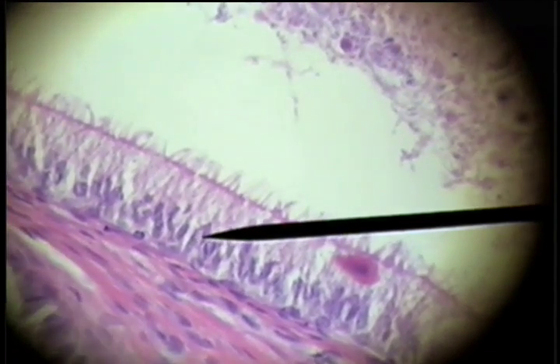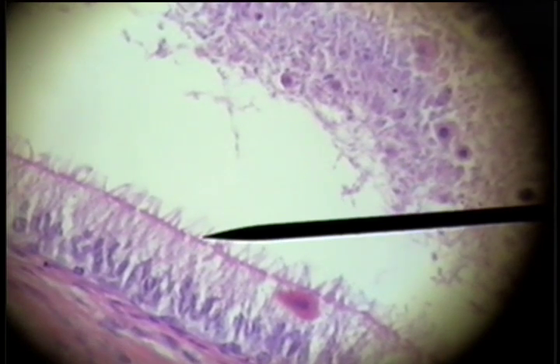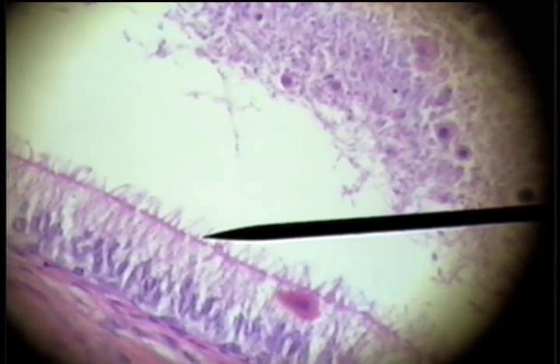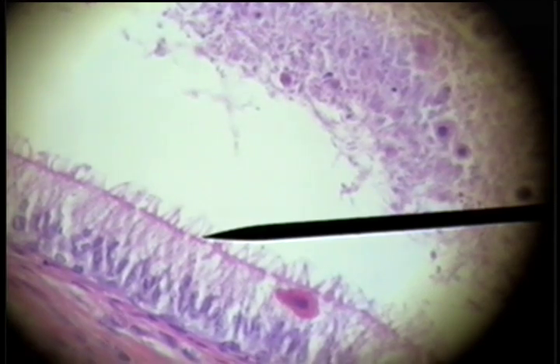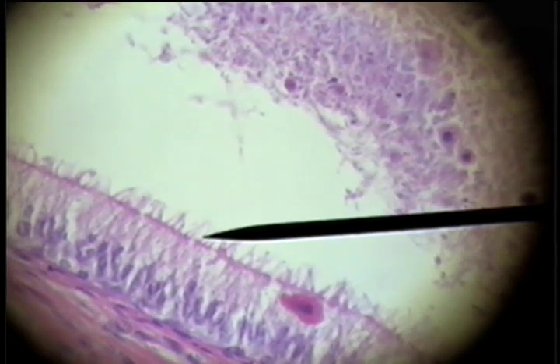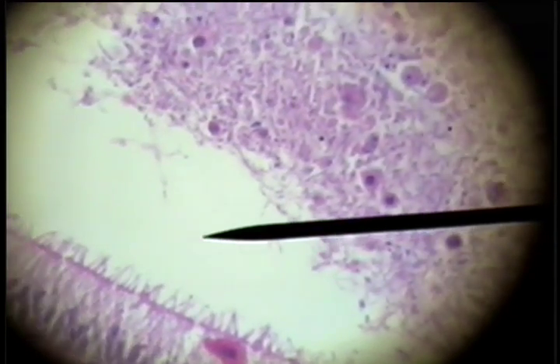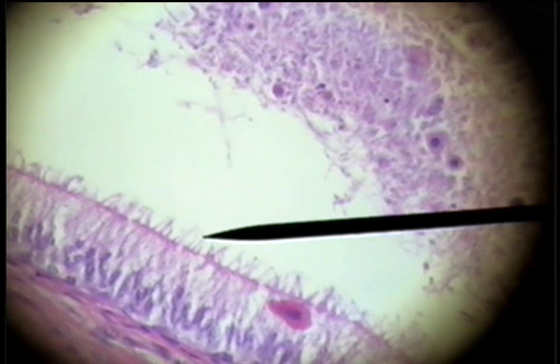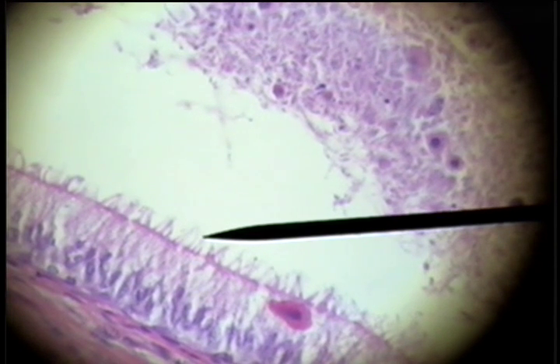But they are not stacked — and here are the cilia on the surface, the very prominent cilia that assist in the migration of these gametes up into the vas deferens of the male.